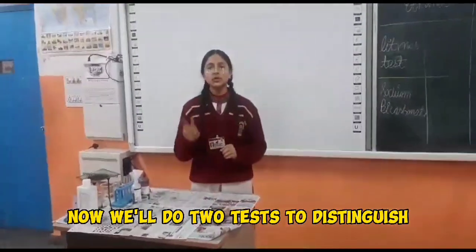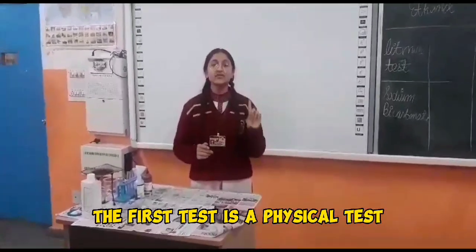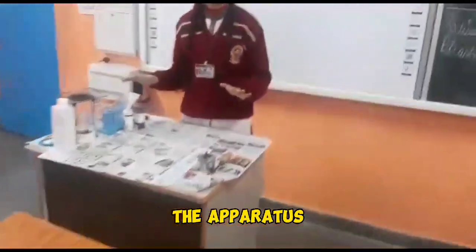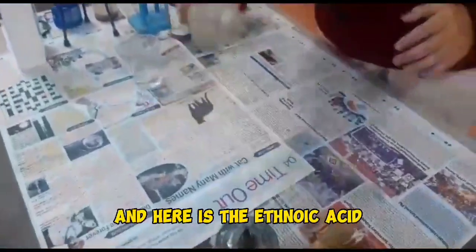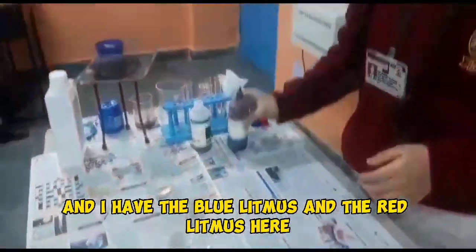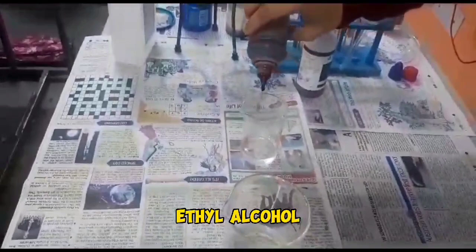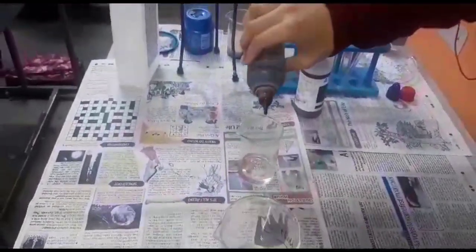Now we'll do two tests to distinguish between both of them. The first test is a physical test, which is the litmus test. The apparatus we need here are ethyl alcohol and ethanoic acid, and I have blue litmus and red litmus here. First of all, I'll take the red litmus and dip it in the ethyl alcohol, and we observe no change.